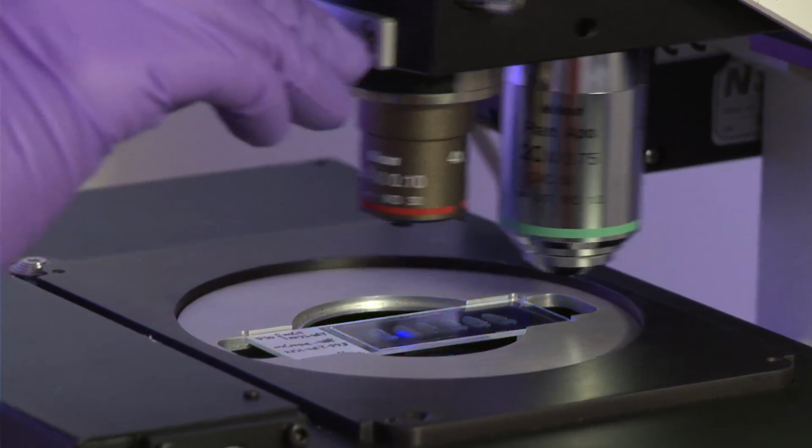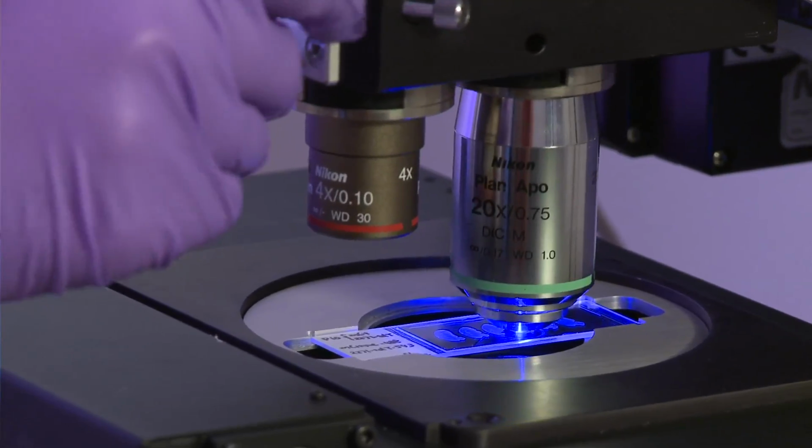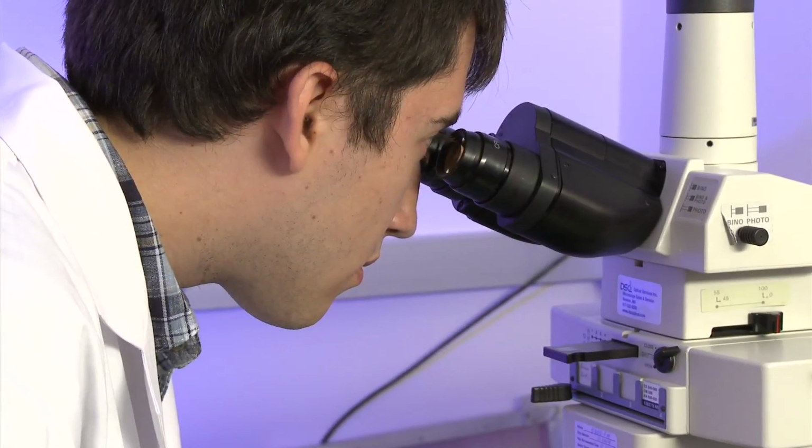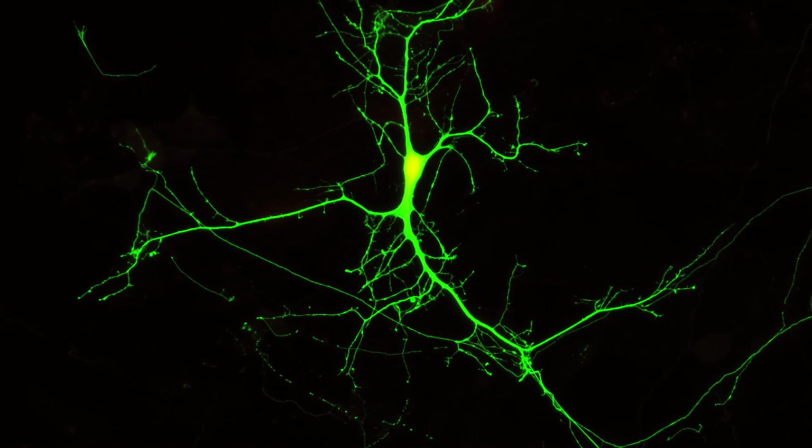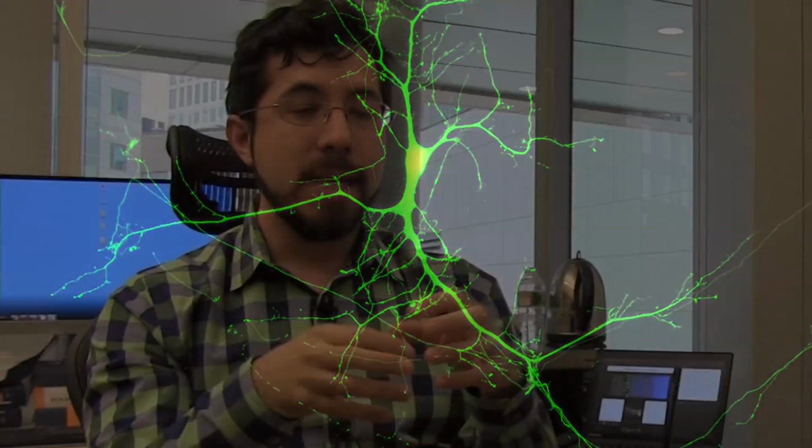For hundreds of years, microscopists have been trying to look at biology. Typically, you take a glass lens and magnify the light coming from a sample, and you get an image that's bigger, and so you can see it. But there's a problem. All of these existing microscopy methods are limited. They can't take a three-dimensional image of a large sample with nanoscale precision.